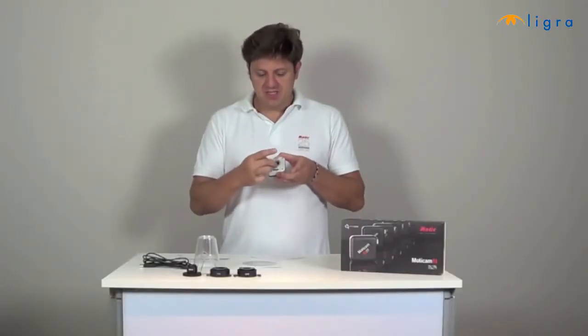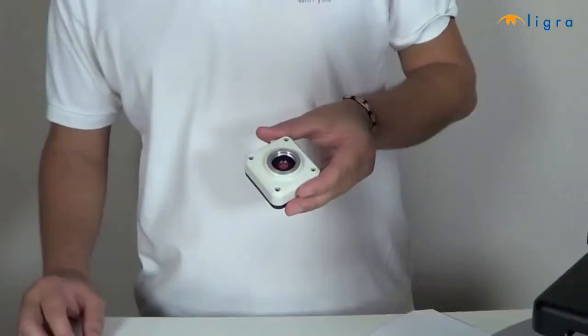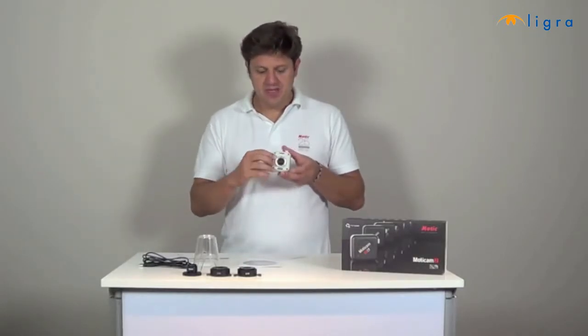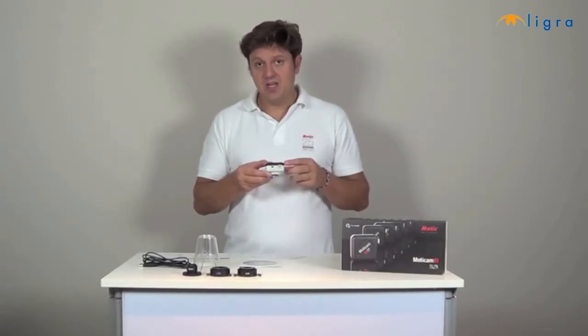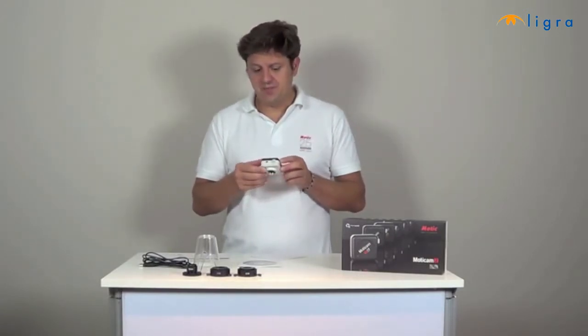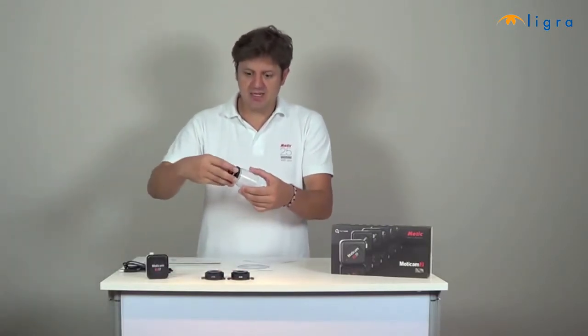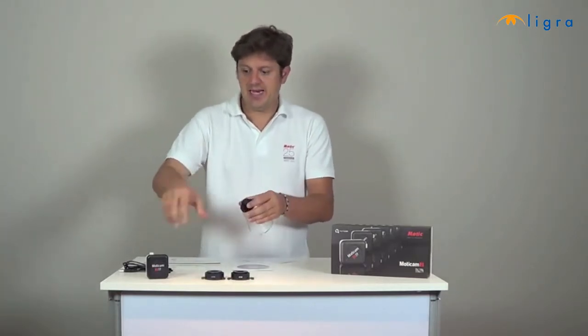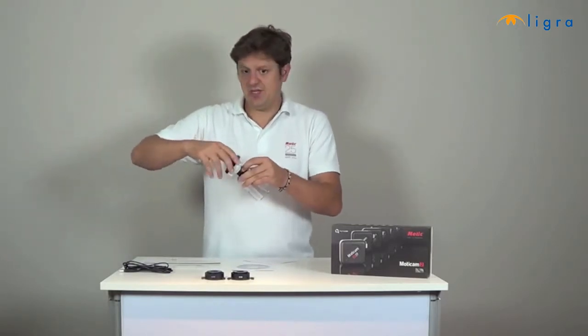At the bottom of the camera there is an opening, and you can see the image sensor behind the protection glass. And this opening has a C-mount thread to screw the camera to a microscope. And there is another thread at the back to screw the camera onto a camera tripod or onto a gooseneck stand. There is also a macro tube for the observation of macro samples, and it has to be used together with the focusable lens. So screw the focusable lens onto the macro tube and onto the Moticam, and then you can use the assembly as a visualizer.